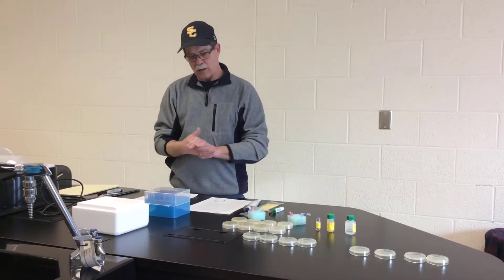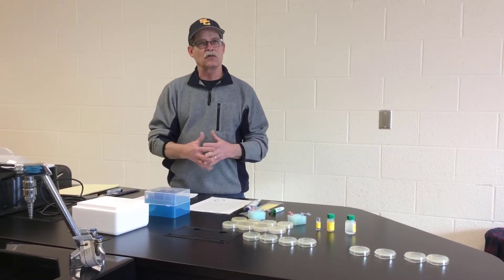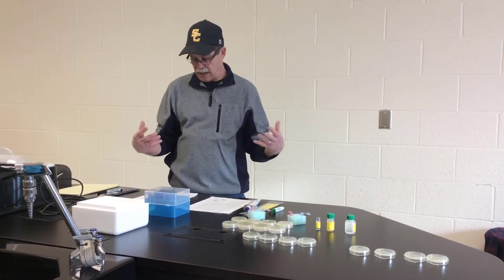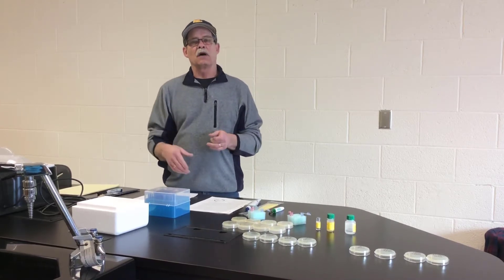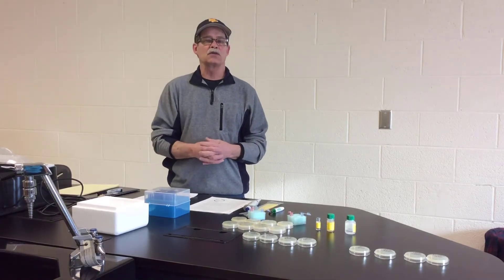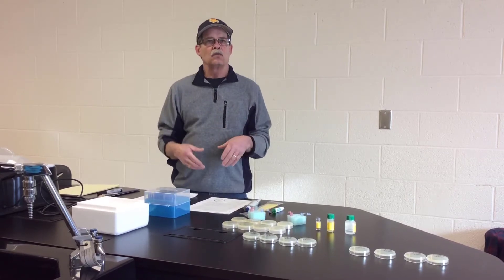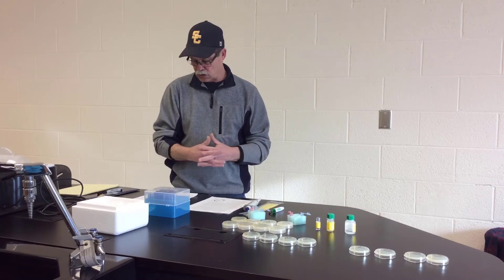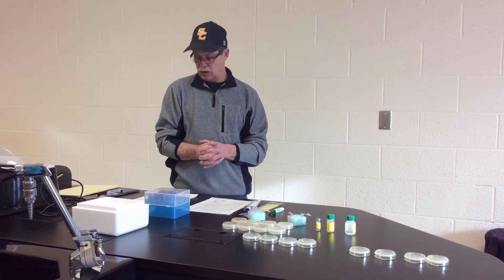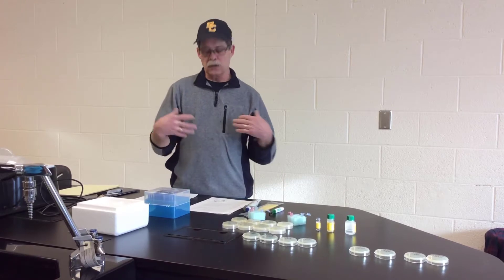Just for a little background before we do the actual procedure, we're going to perform a genetic transformation today, which is essentially a change caused by genes. A gene is a piece of DNA that provides instructions for making a particular protein. The DNA is encoded with the message to produce this protein, which usually serves in some cellular function and gives an organism a particular trait, or what we call a phenotype.